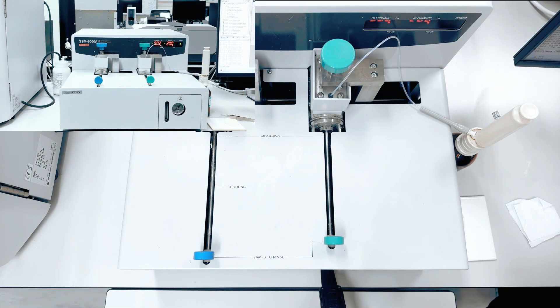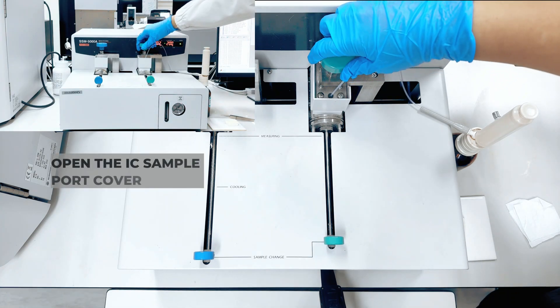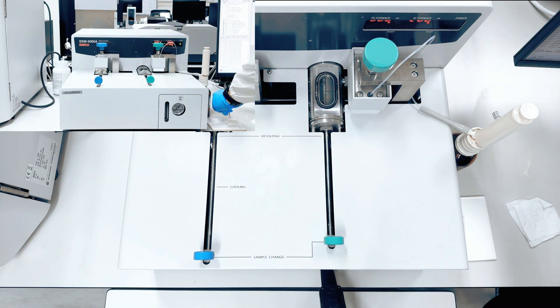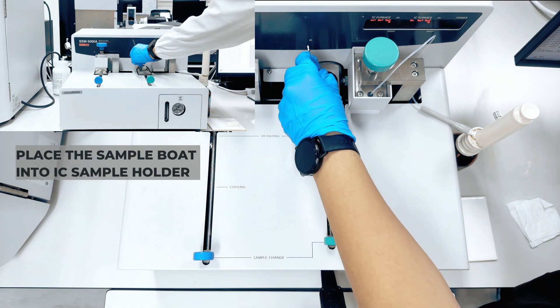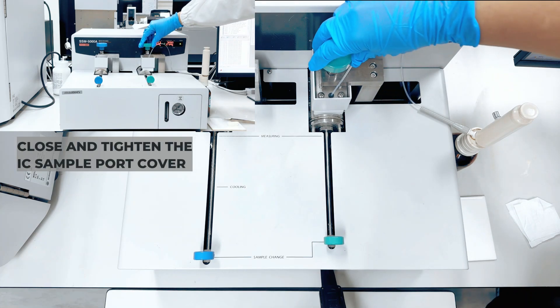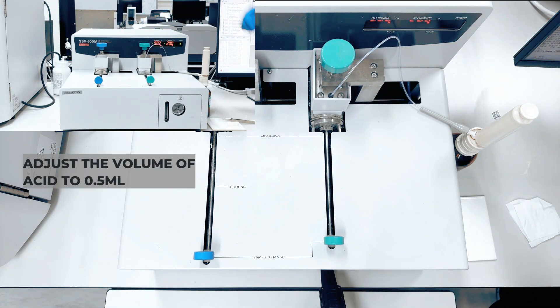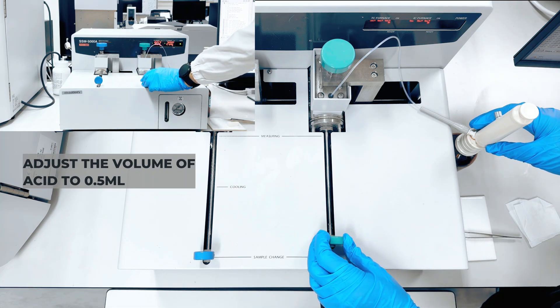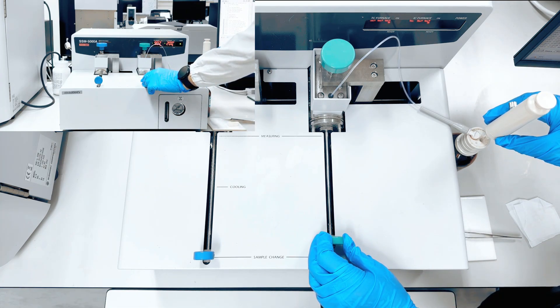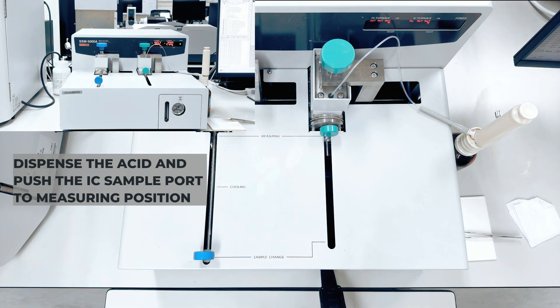Now we will move on to the measurement of IC content. Open the IC sample port cover, place the sample boat into the sample holder, then close and tighten the cover. Adjust the volume of acid to 0.5 milliliters. Following the window instruction, dispense the acid and push the IC sample port to the measuring position immediately.